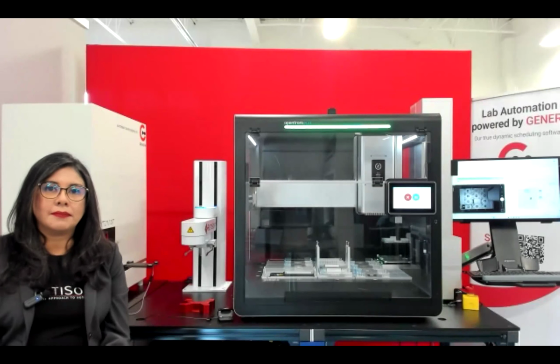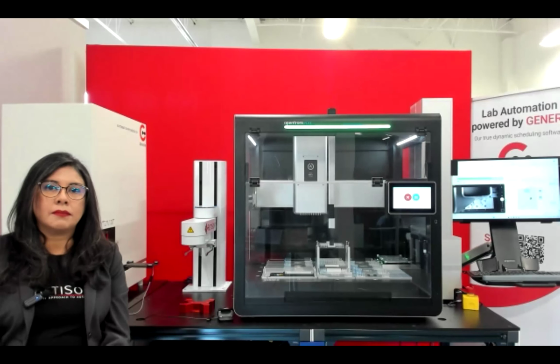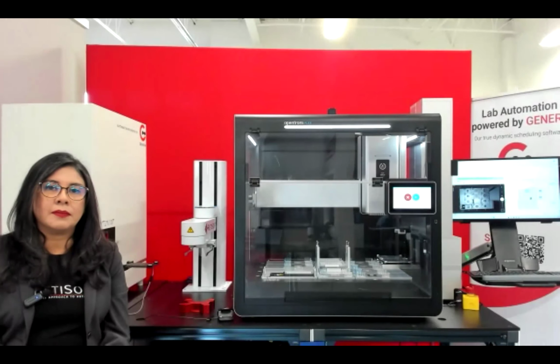Okay, another question here. The Genera driver list, someone went and checked out at our suggestion, which is fantastic. Someone's doing their homework in real time. That the list includes the OT2. Would a system that uses that instead of the Flex operate similarly minus the gripper functionality, or are there more significant workflow or communication differences?